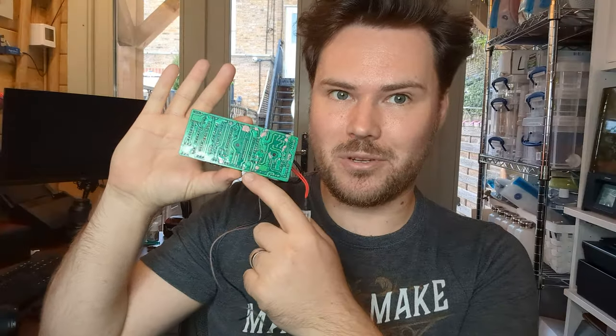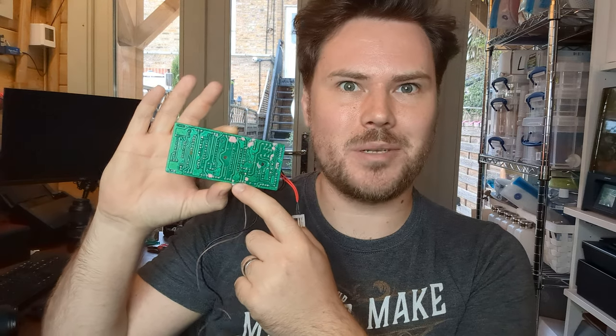Okay, all fixed up. I've got some nail polish on there. I didn't pick the colour, but it's the one I could find. Now it's time to put this back together, and we're done.